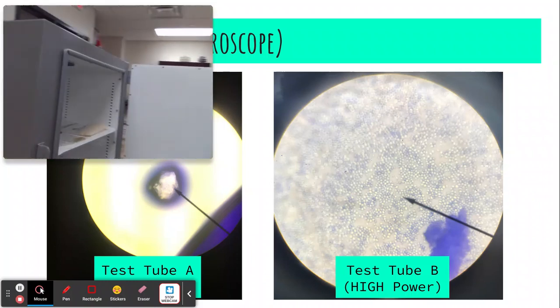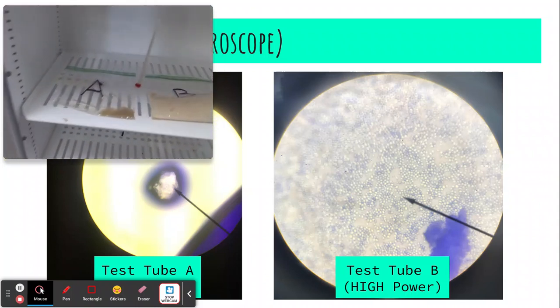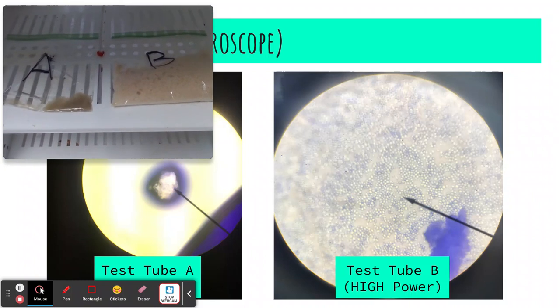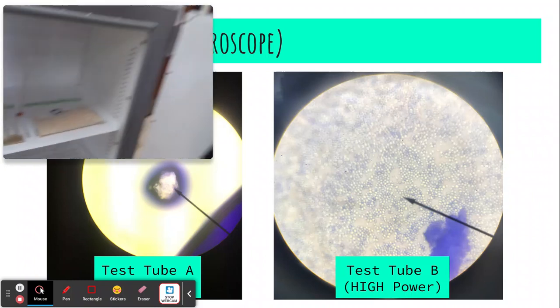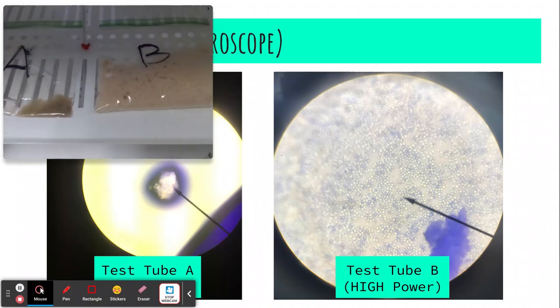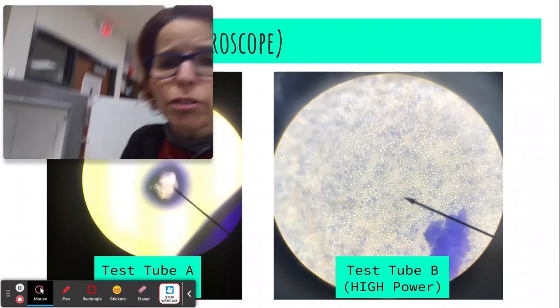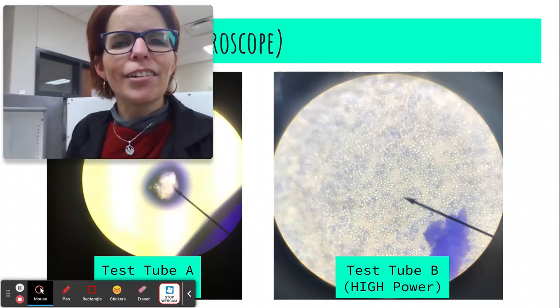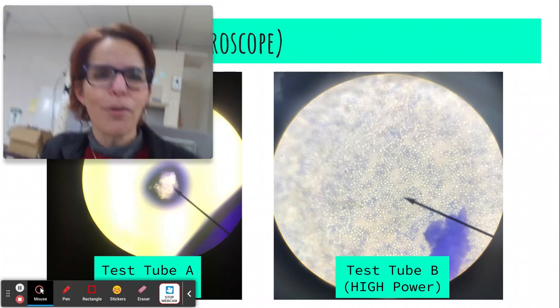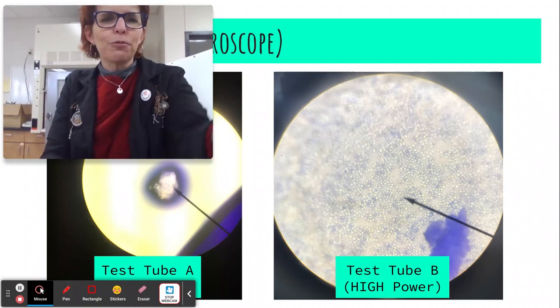Bringing it in. Oh, they totally look different. Can you see that? Look at A and B. Can you see that B is all full of bubbles? It's all puffy. And A just looks like it always does. I hope you can see that on the camera. Okay, so we've shown now again a sign of life. B ate the sugar that we gave it. It started to reproduce, it started to grow, and it started to produce waste, which are those bubbles. So we have more evidence for life.